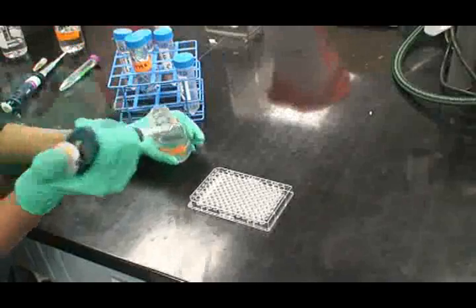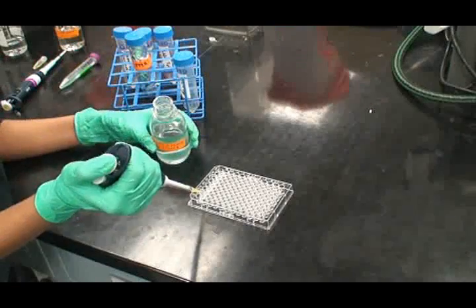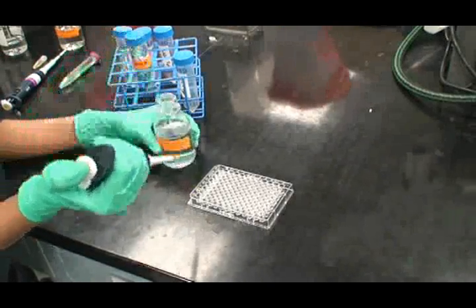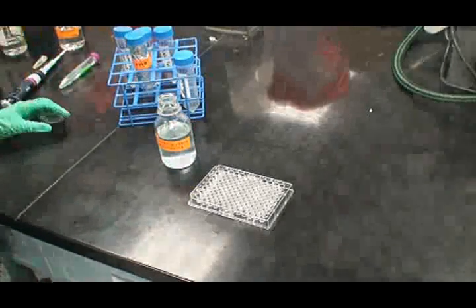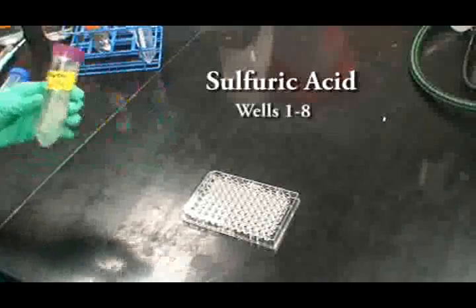Incubate for 15 minutes at room temperature or until there is good color formation. Stop the reaction by adding 100 microliters of dilute sulfuric acid.